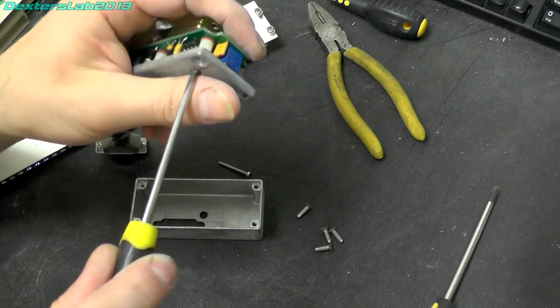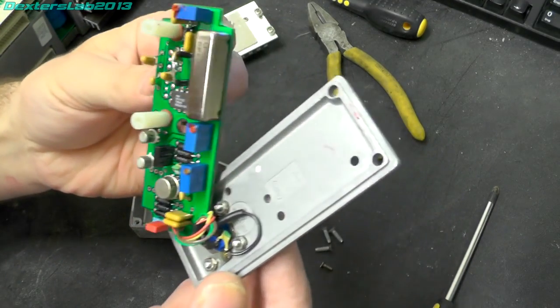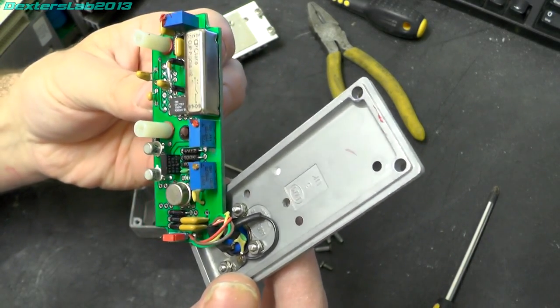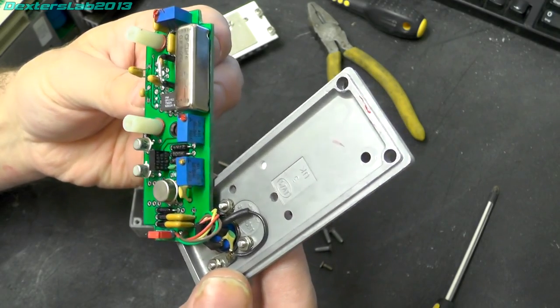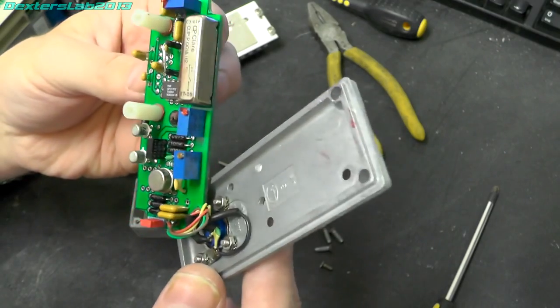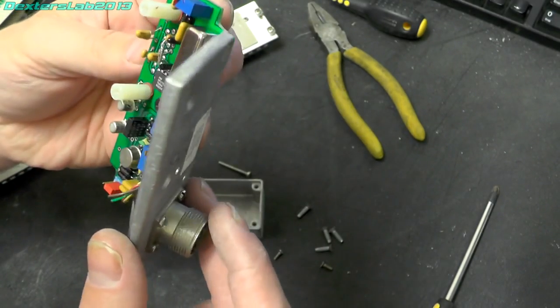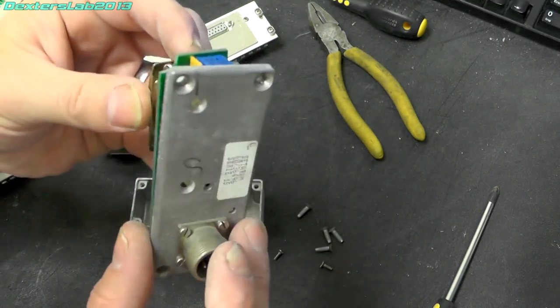Let's take the front off it. So yeah, we've got an op amp in there, and there's a relay as well. So, not really sure what this is for, but it's obviously signal conditioning or something, preamp.